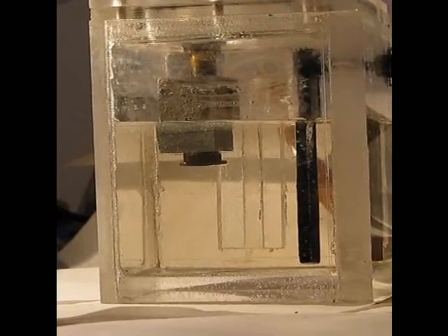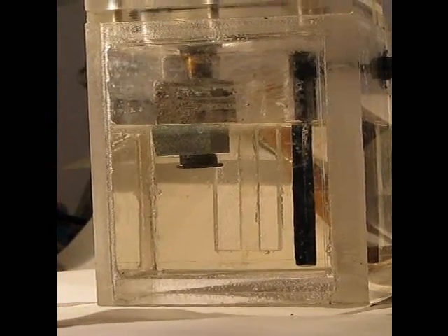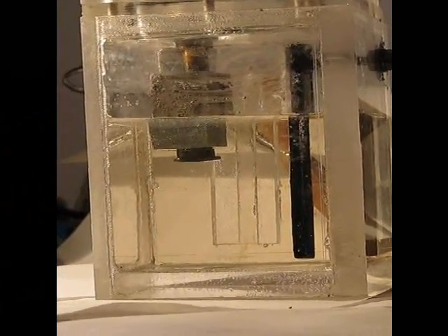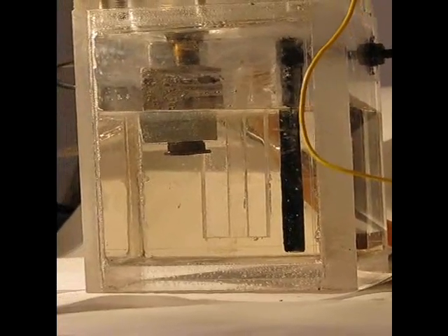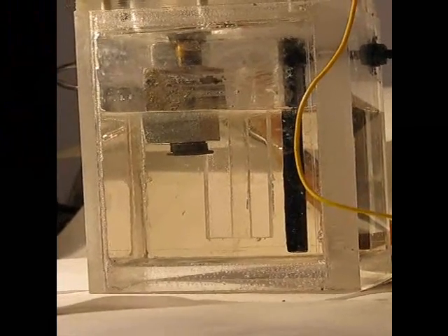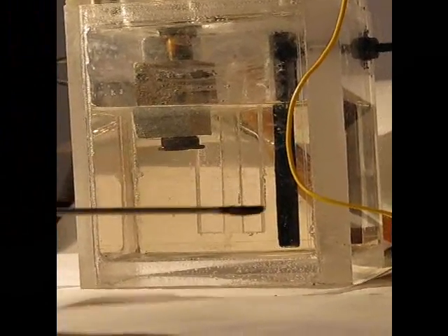I'm going to keep the level there because it'll be a little bit easier to see what's going on. Now you can see that there's virtually no reaction on the aluminum. As always, I'll make an electrical connection and we'll see that we have hydrogen coming off of the nano-nickel.